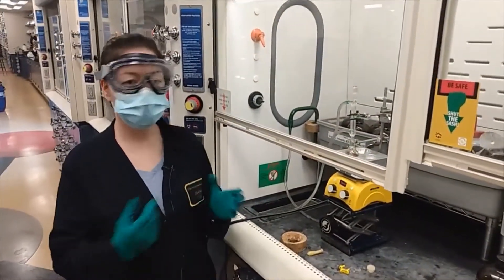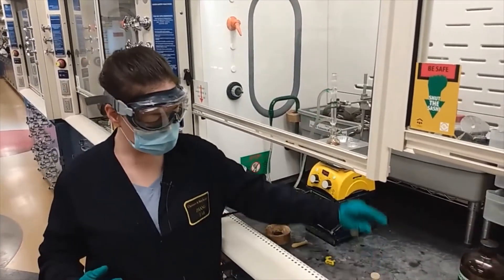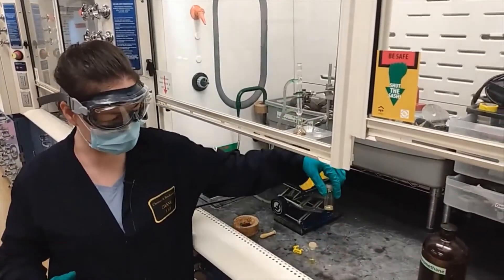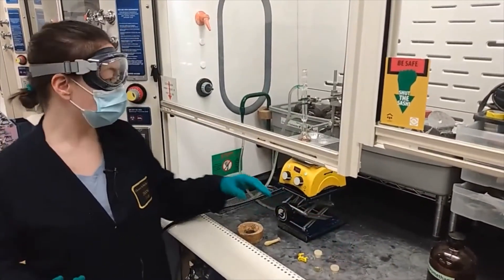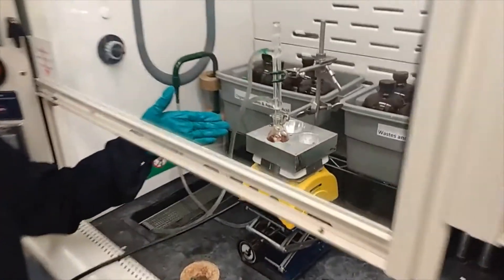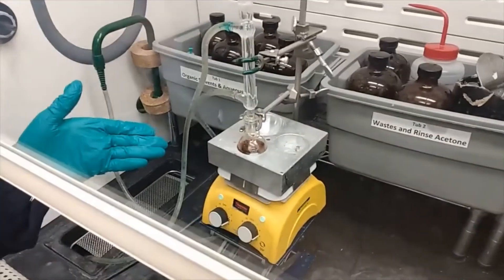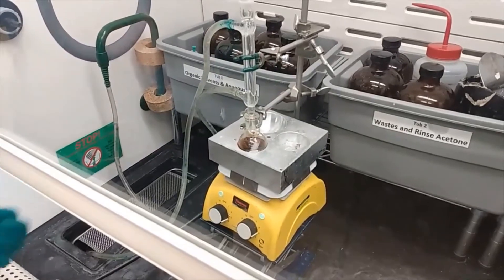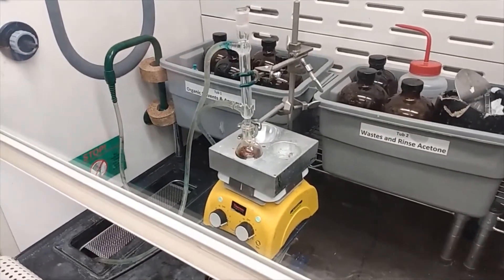So 15 minutes have passed. We took out 5 and 10 minute aliquots for TLC. And you notice the color change from a light bright orange to a dark red-brown or red, almost black kind of orange color.